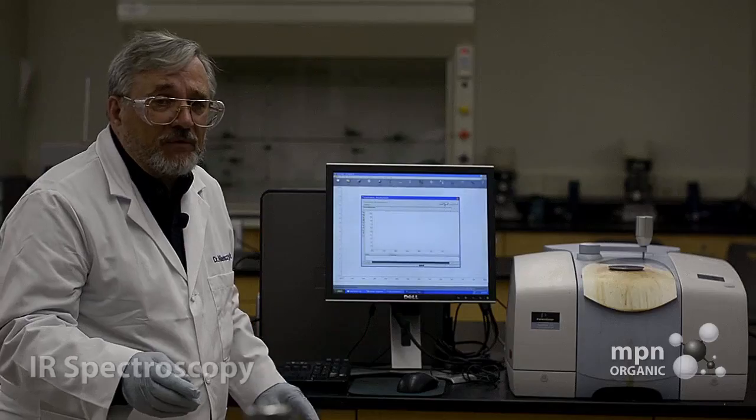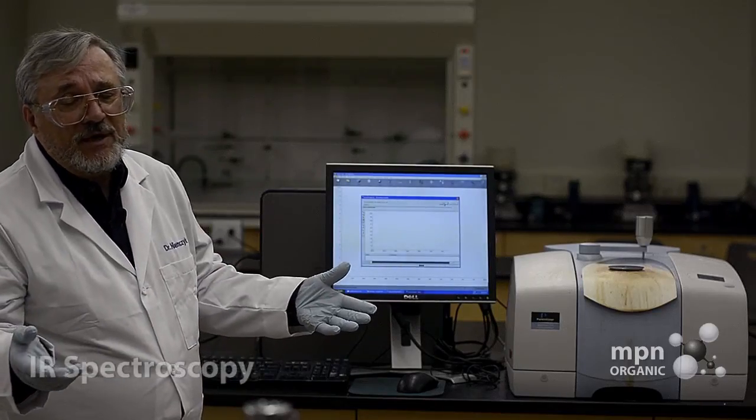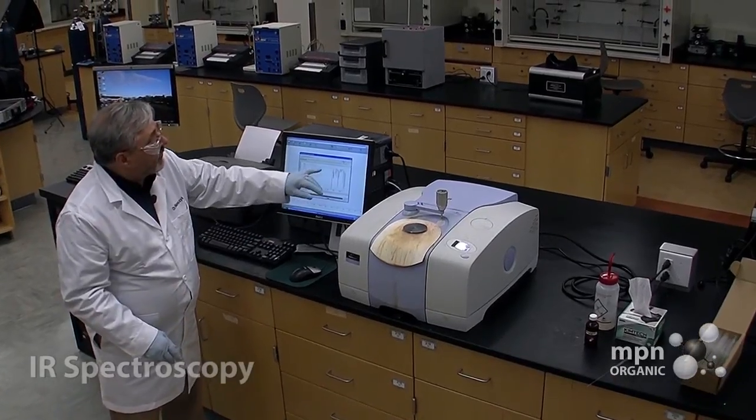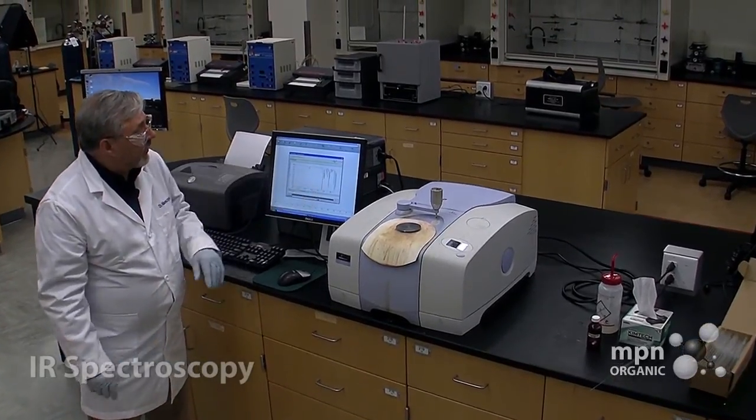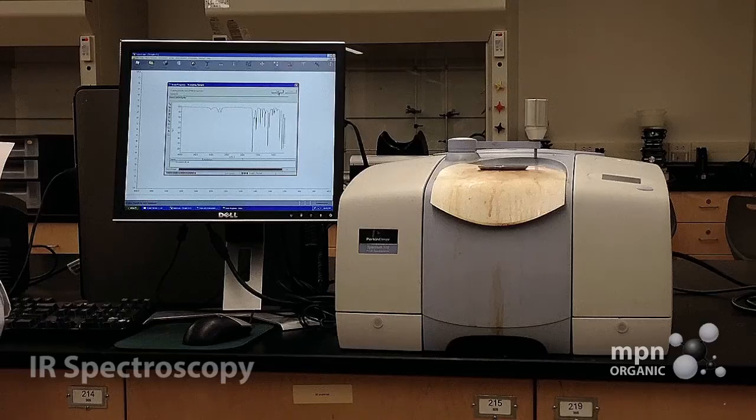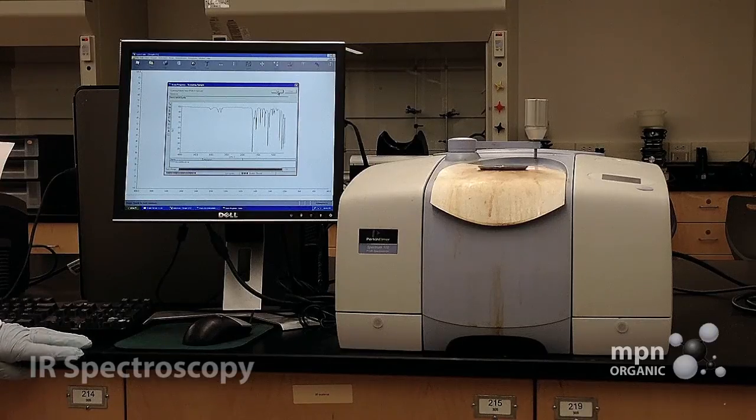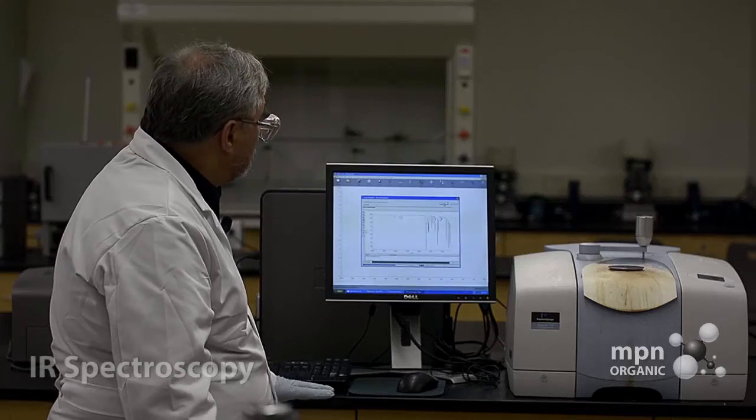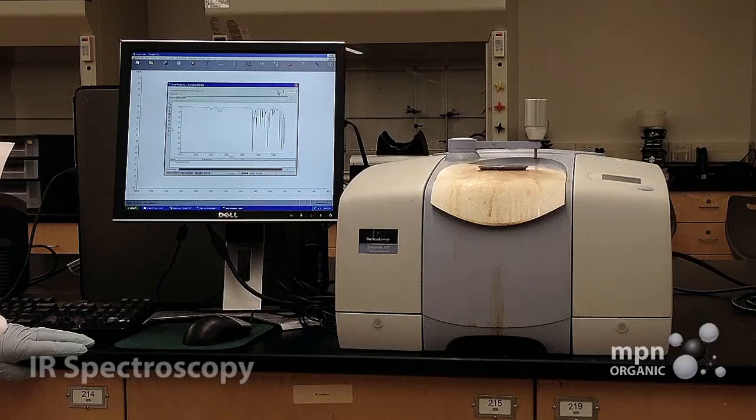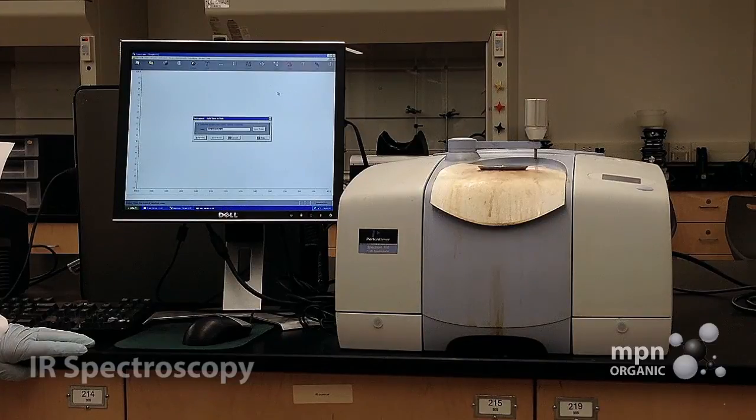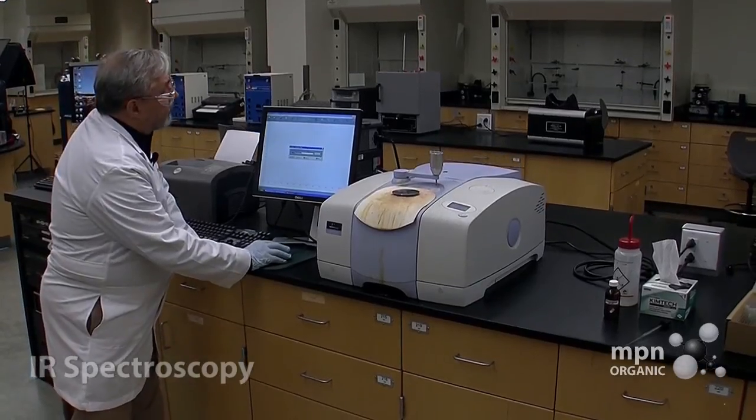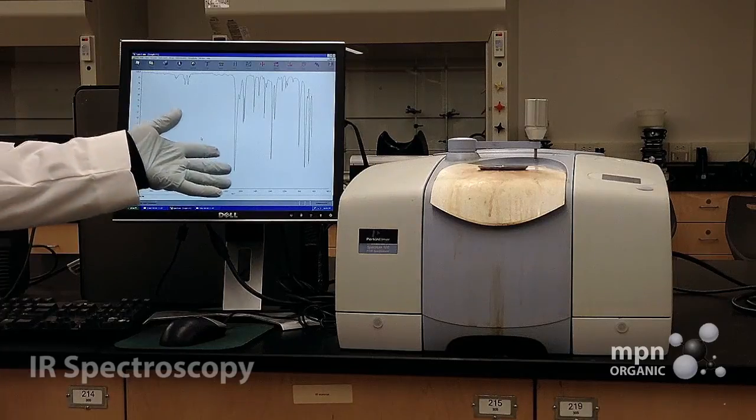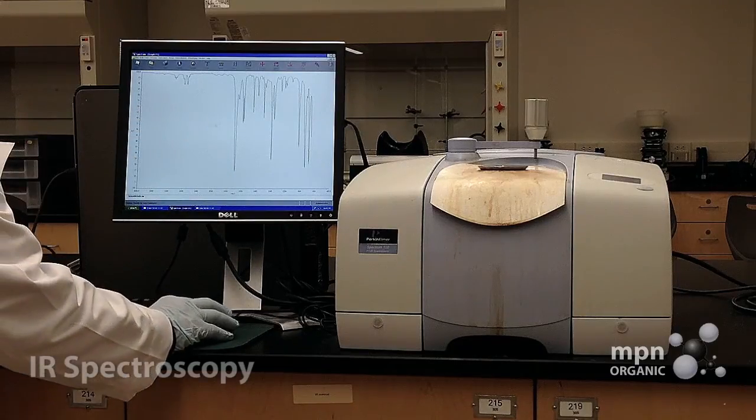Just like with the background, it's going to have four pulses, and you'll see them accumulating here. And you can see right here the spectrum now of benzaldehyde. And it usually takes at most a minute. It says to overwrite, yeah, we're going to overwrite this. That's fine. And so there's a spectrum of benzaldehyde. It didn't take too long, did it?